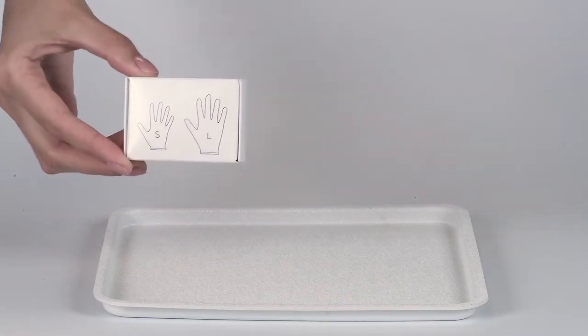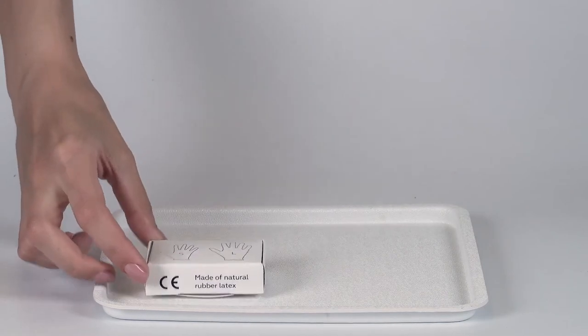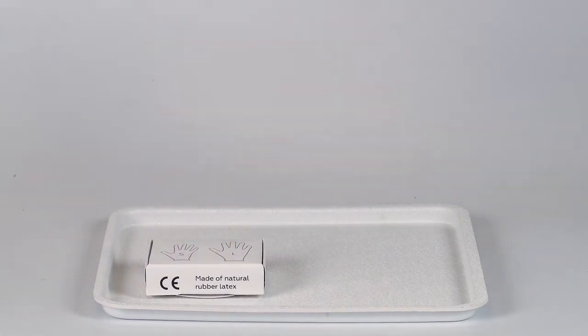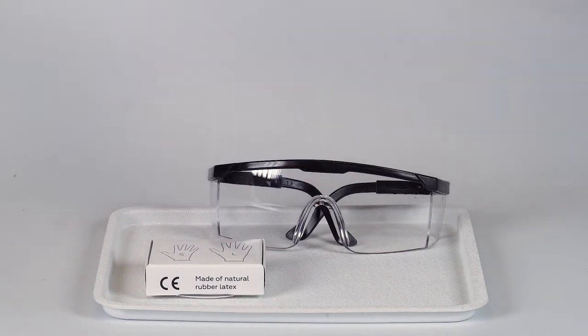Perform this experiment on a plastic tray to keep the table clean and contain any spills. Make sure to put on gloves and protective glasses before you start.